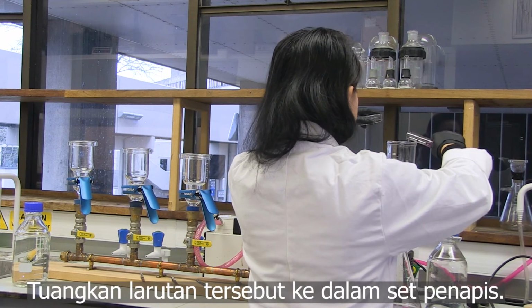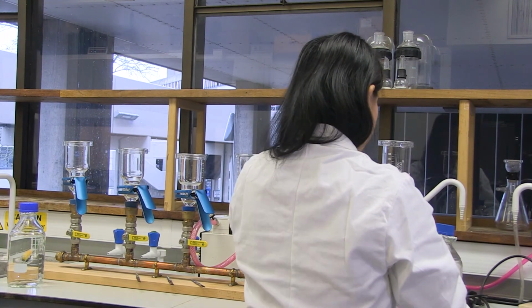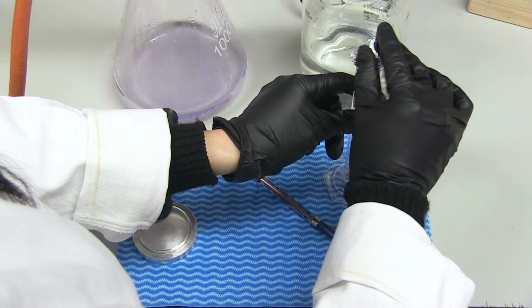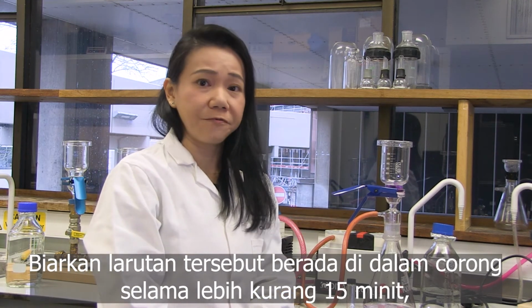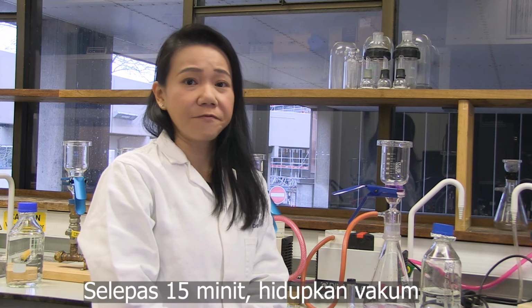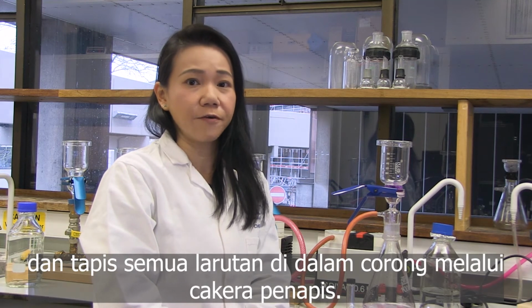Pour the solutions into the filtration funnel. Let the solution sit in the funnel for about 15 minutes to allow sufficient time for the staining process. After 15 minutes, turn on the vacuum and filter all the solutions in the funnel through the filter disc.